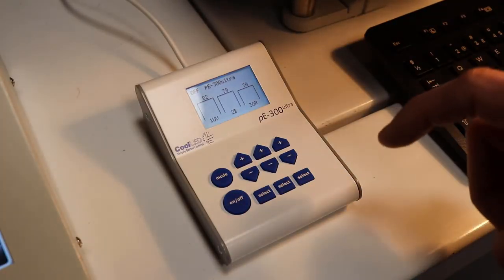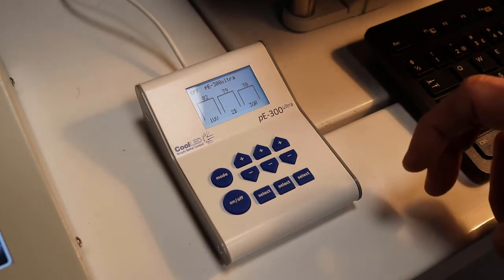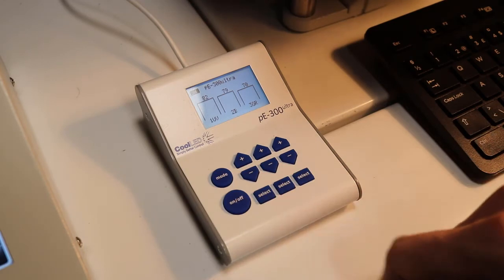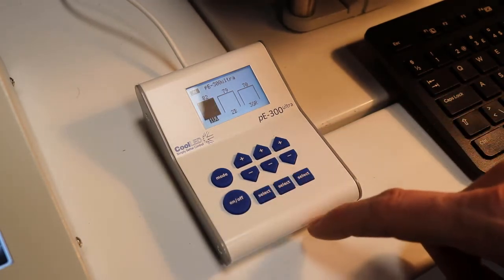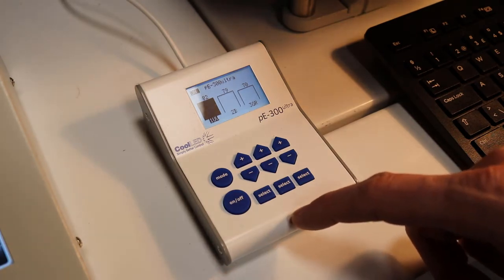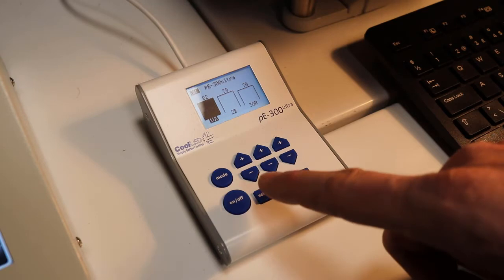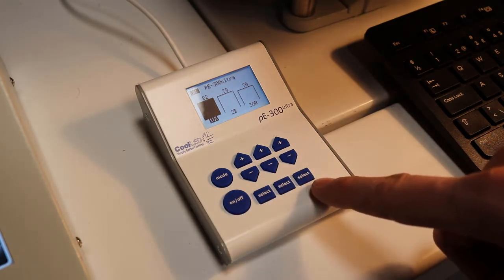So if you want to control the microscope manually, then you also need to manually control the light source. That is, first of all, turning it on. When it's turned on, then you need to select the wavelength. So this is the UV diode, and it has UV, a blue color and a green-red color.